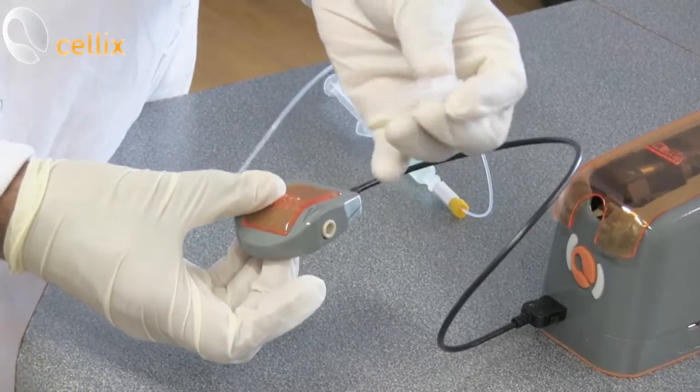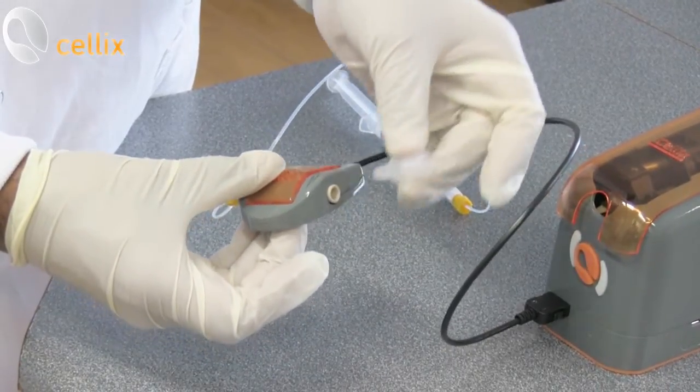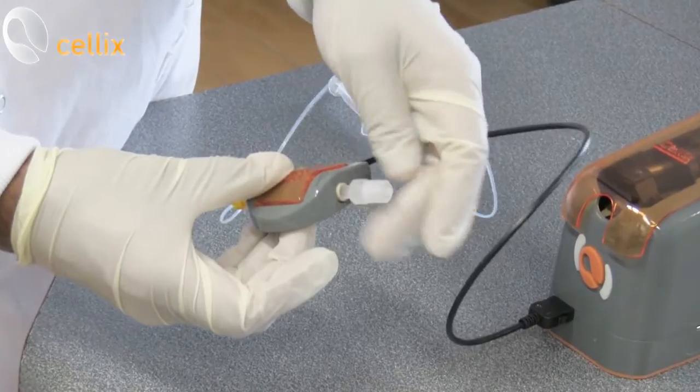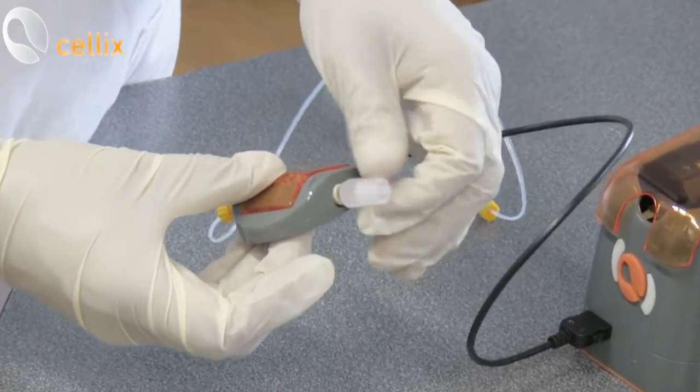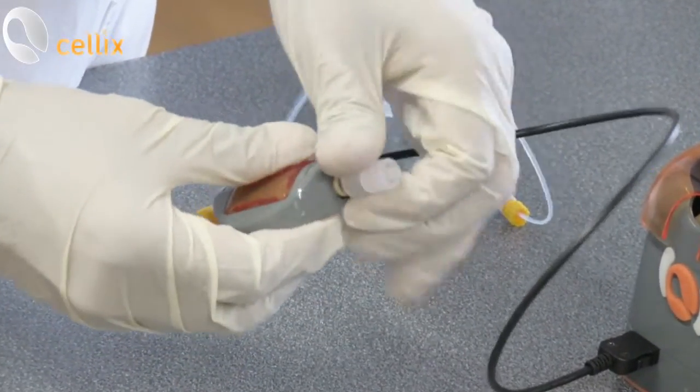And to the output, you have this white connector. Tighten it.